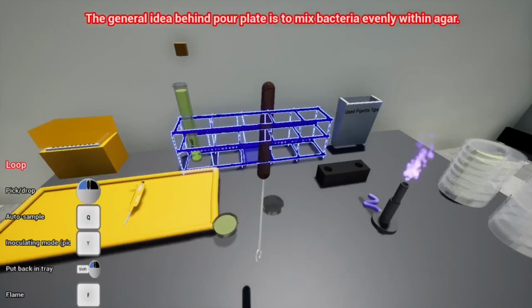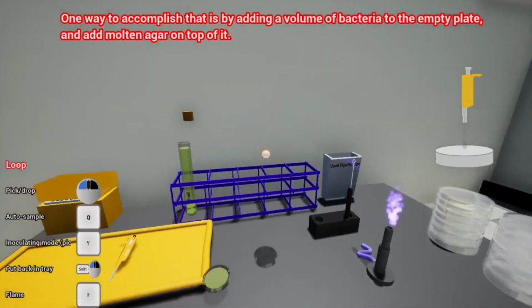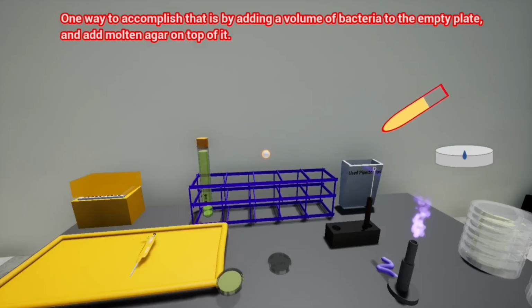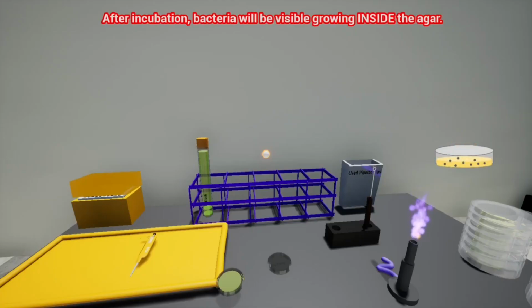The general idea behind pour plate is to mix bacteria evenly within agar. One way to accomplish that is by adding a volume of bacteria to the empty plate and add molten agar on top of it. Once the agar solidifies, it will have the inoculum spread evenly within it. After incubation, bacteria will be visible growing inside the agar.